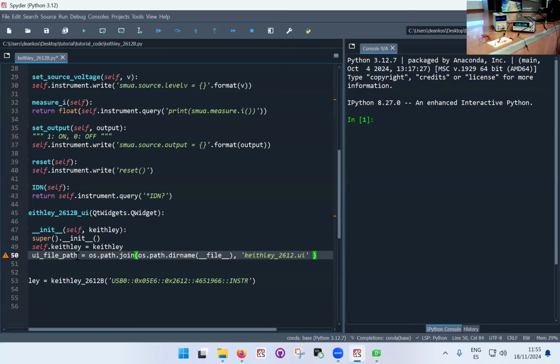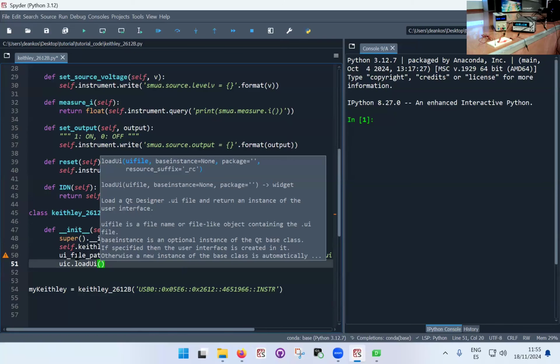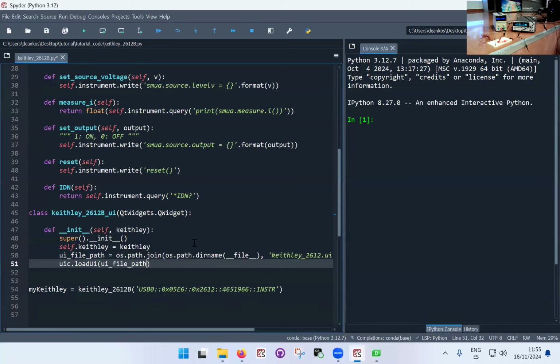So that's the user interface file path, and now we're going to add through this piece of syntax the user interface loadUi, and here we're going to put the UI path and then self. This again is take it as it is. We can't go into the details right now of why it looks like this. I personally also, when I program a new piece of kit, just copy paste these few lines, and I also personally don't go into the details of how UIC works and why these are exactly the arguments that we're using.